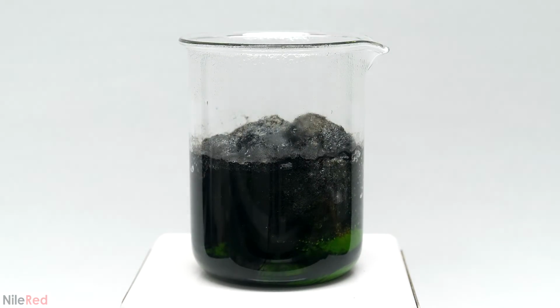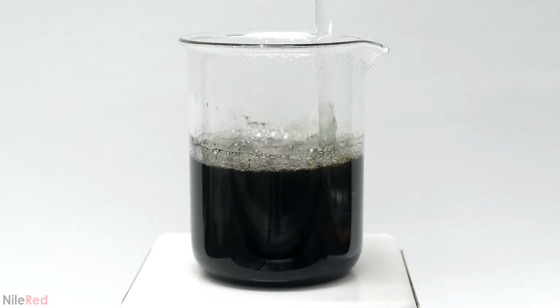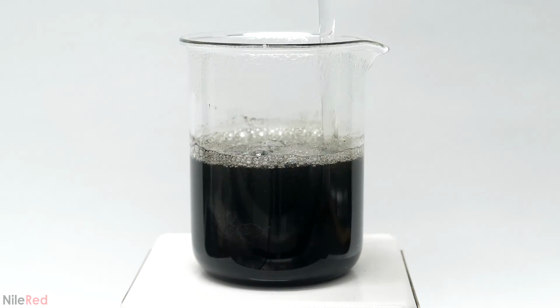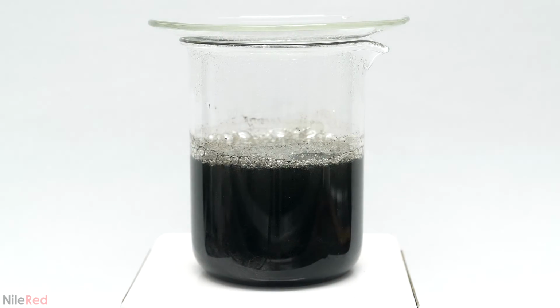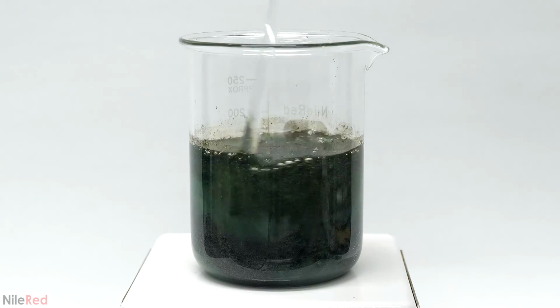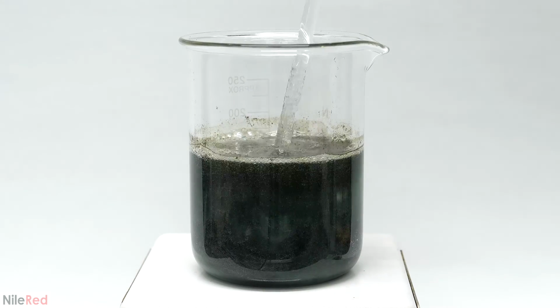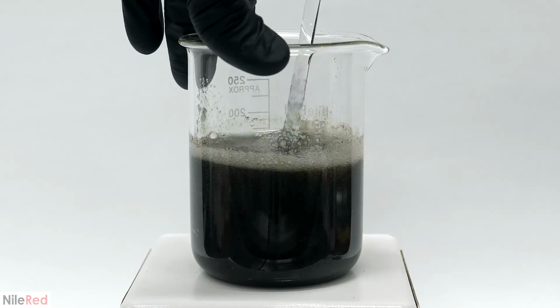By now, it looked like the red-orange color was pretty much all gone, and it was probably getting close to being done. However, I wanted to be really sure that there was no iron 3 left, so I let it sit overnight. This was what I had in the morning, and it wasn't exactly beautiful. There was still a lot of steel wool left, but there was also this whitish-green solid that had formed, which I think was just iron 2 chloride.